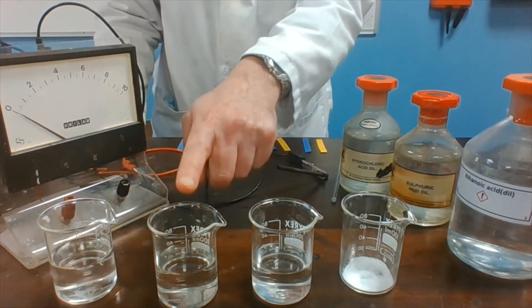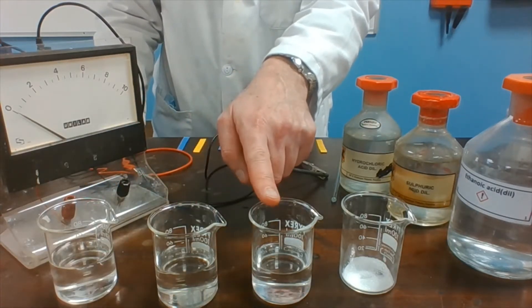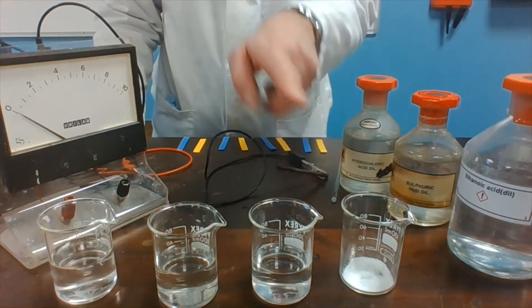This is hydrochloric acid, sulfuric acid, ethanoic acid and citric acid.